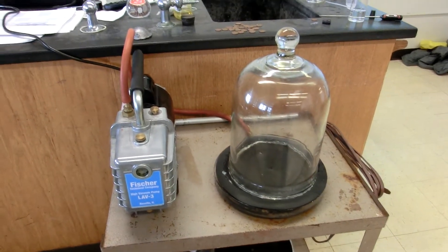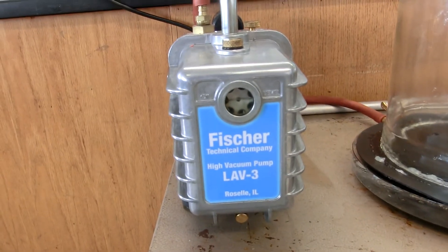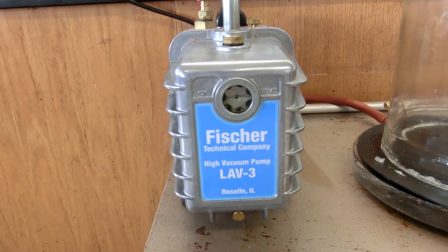This is a brief introduction to a vacuum pump. Right now we are using the Fisher Technical Company high vacuum pump LAV-3. It came out of Roselle, Illinois.